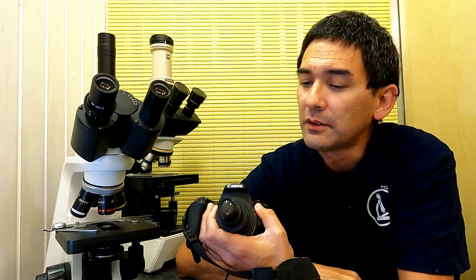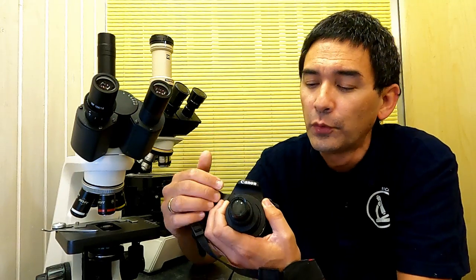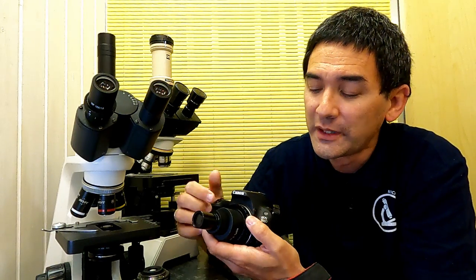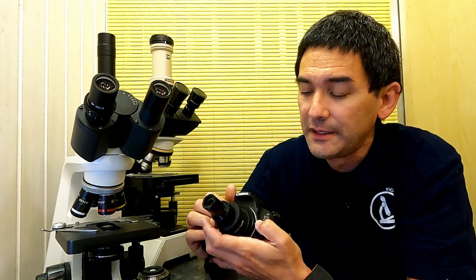That's really important. And of course, any decent adapter should also have a system to minimize internal reflections. Otherwise it's hazy, the light is bouncing around and you do not really get the contrast. And that's kind of the idea of an adapter, and that's why I bought it, also to make a review for you. I was kind of hoping for finally a new product that I can share with you, and then you can also connect your DSLR cameras, because I do get a few emails where people want a suggestion of which adapter to buy. So that's kind of the idea.